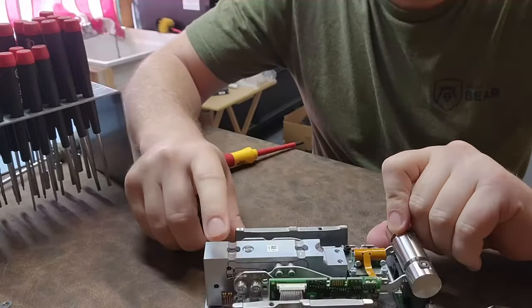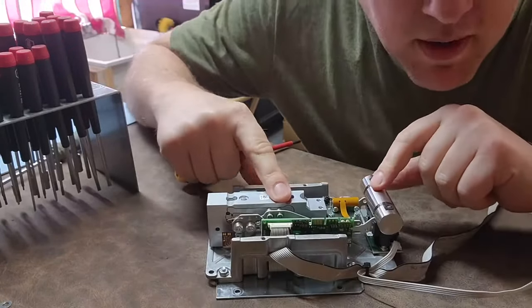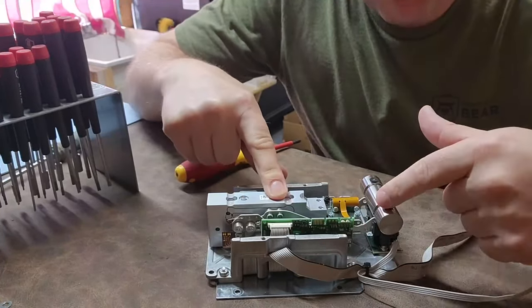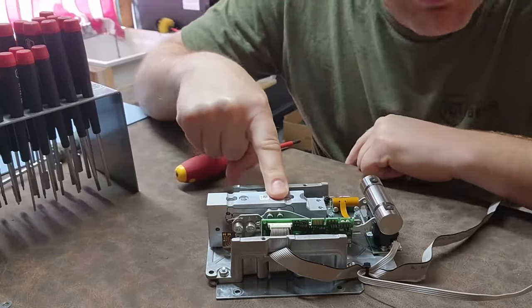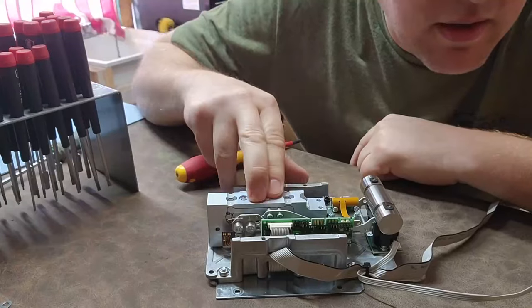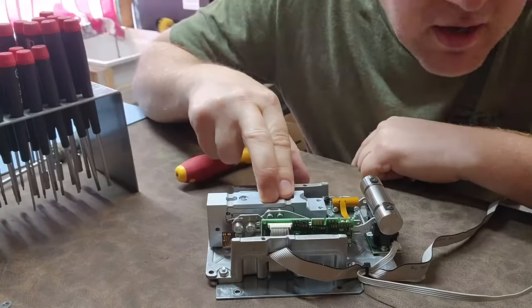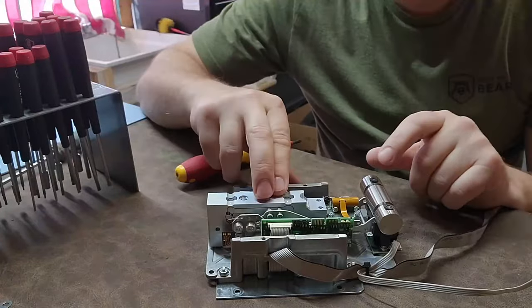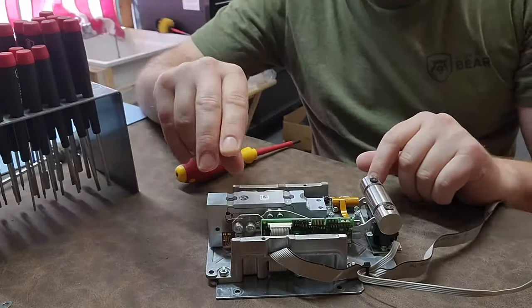What I have here is a little bar — there's a little bar right here that moves when I press down. I believe that is an overload sensor. It goes up, hits something, and detects right here — I believe that is overload protection.